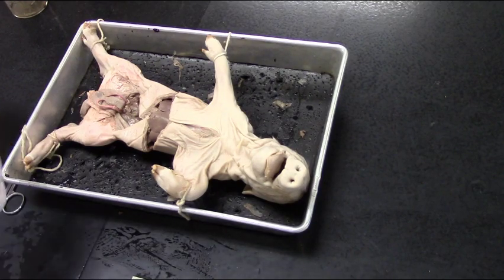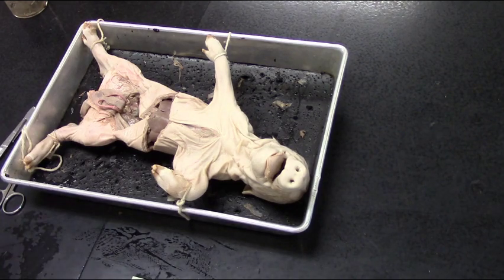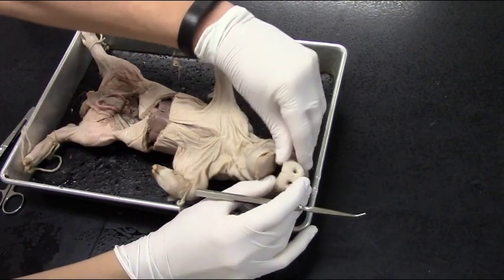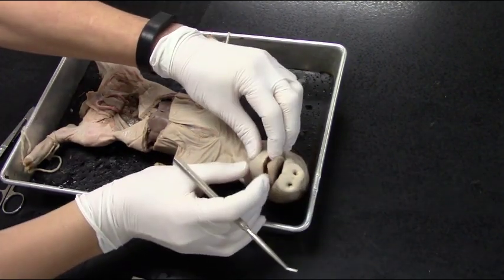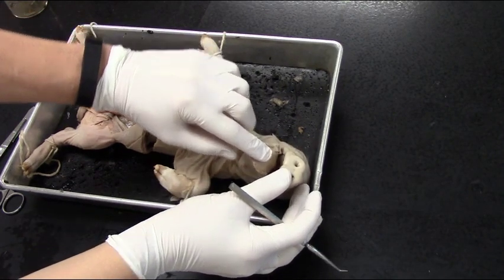Today we're going to take a look at the structures in the mouth of the pig and in the chest cavity to look at the respiratory system. We can see the external structures really clearly. Those are the nares. We can feel around for some teeth, usually on the top and bottom, and we can see the tongue as well.